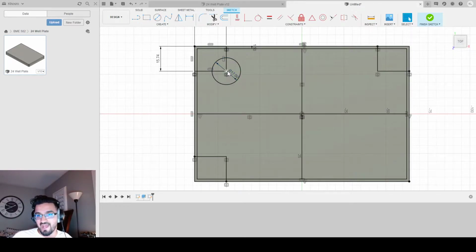So now I have a circle at this origin point with a diameter of 17. If you watch my previous video, you know that next we're going to have to create another line that's about 17 across again, and create another circle and keep going and going and going. But we're not going to do that in this video. We're going to do it the actual way I like doing it, and that is to create a rectangular pattern.